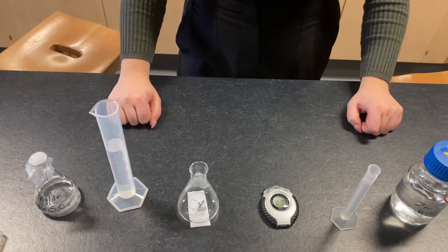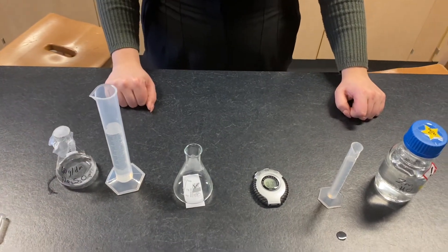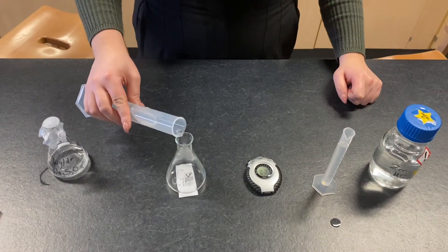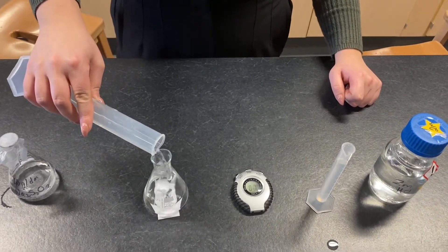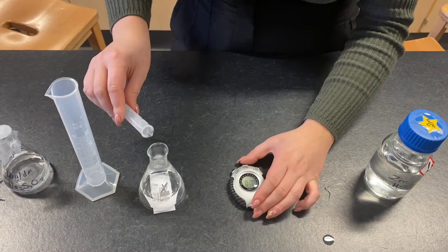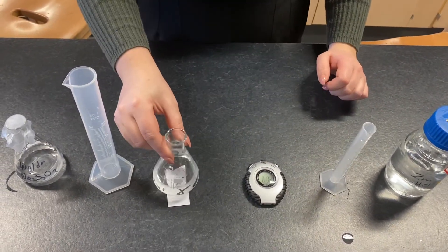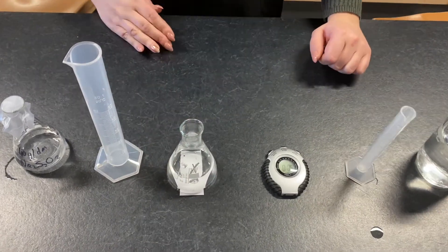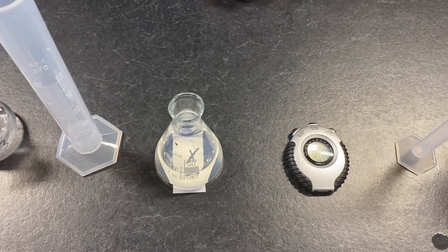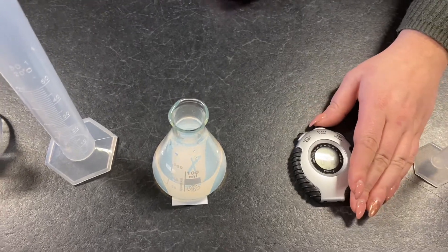Now we're going to do it with a stronger concentration — we've got 40 grams per decimetre cubed of sodium thiosulfate. We're going to pour 50 centimetre cubed into a measuring cylinder, pour it into our conical flask, then add our hydrochloric acid and start our stop clock. Stop your stop clock when you can't see the X.